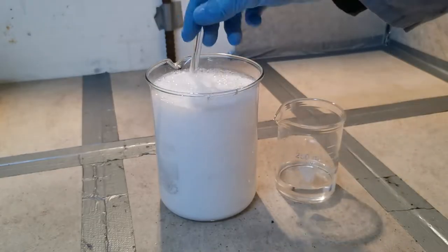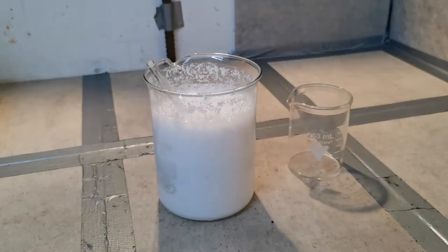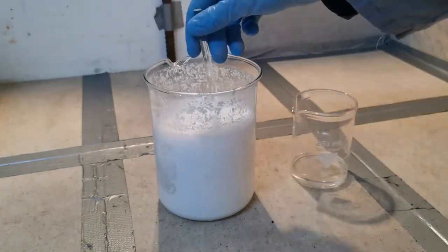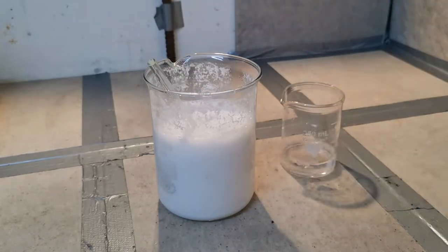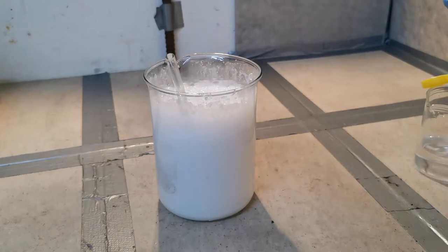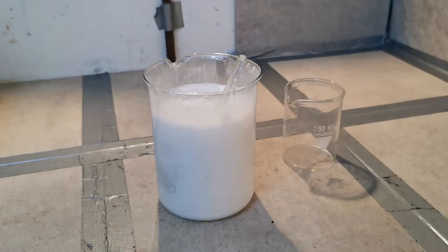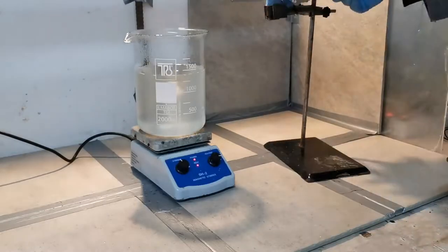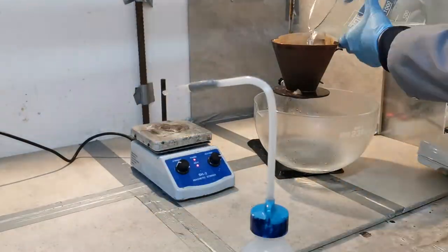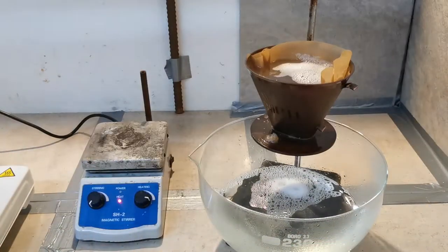As a side note, I tested the acetic acid I tried to use at the beginning and there was some zinc in there. So I decided to keep it and use it now to dissolve the zinc carbonate. This was quite straightforward. Although it tried to foam up a little, adding the acid popped all the bubbles anyways. Once the solution is almost clear and the pH is slightly acidic, I filtered again and now it's just a matter of boiling it down and get some nice crystals.